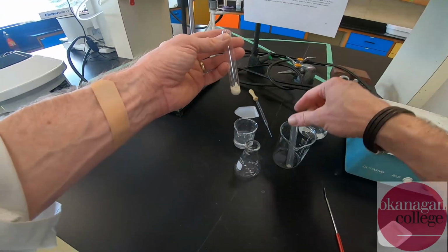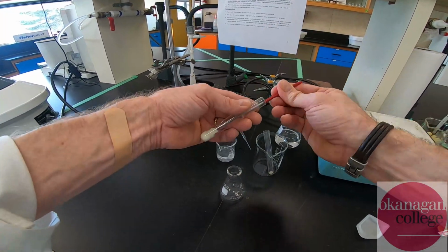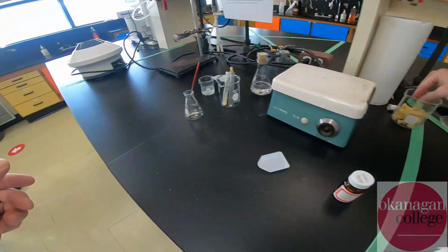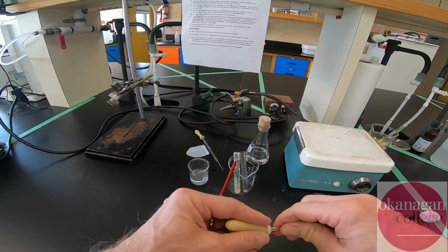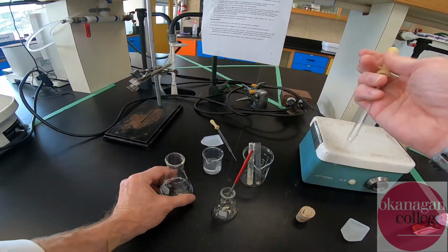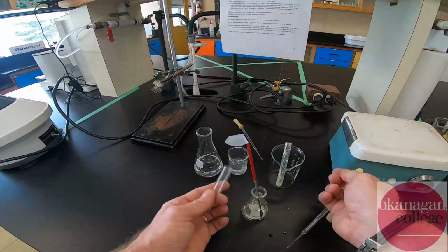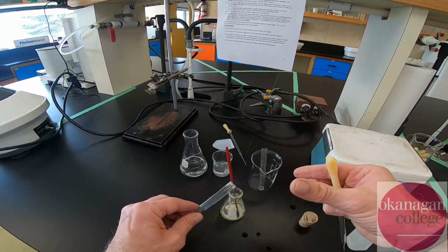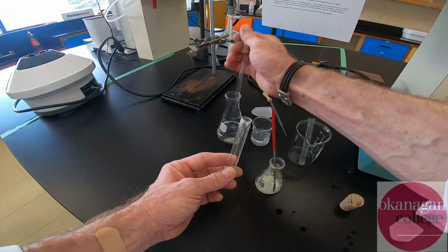All right, so now I've got our two solids of our product. I'm going to transfer that into a 50 ml Erlenmeyer flask. Because I'm not going to be able to remove all the material with that spatula, I'm going to use a small amount of the recrystallization solvent and just rinse the test tube out. Okay, and this I think will work fairly well to transfer that smudgy material. And then this I'm going to pour out. Now, the manual suggests that we use no more than 20 mils of solvent to recrystallize, so I can actually use a fair amount of the recrystallization solvent to transfer over the material.